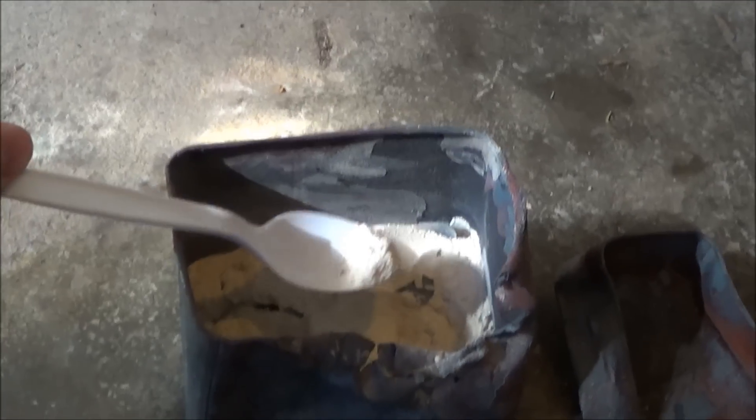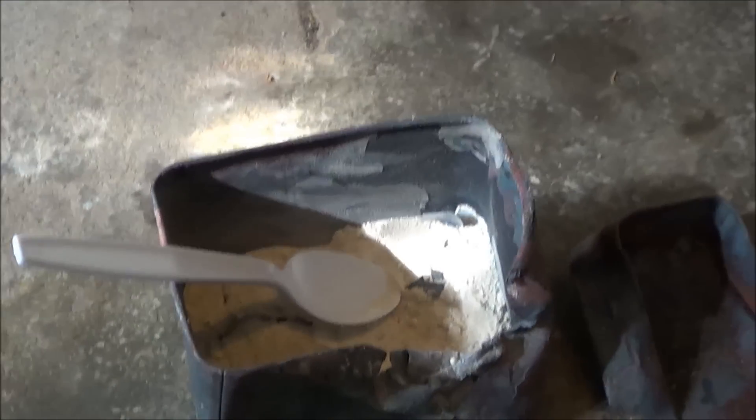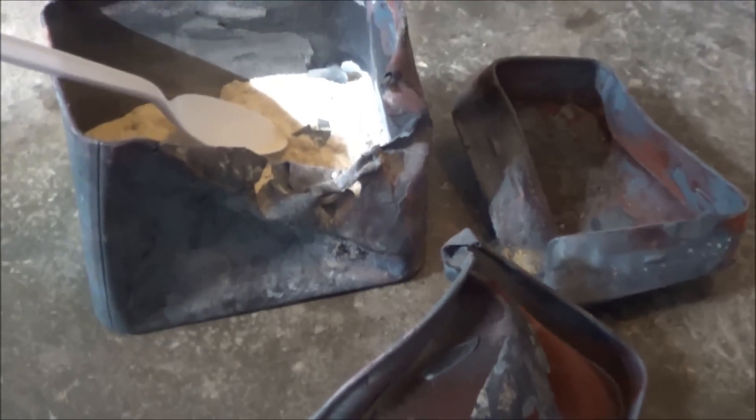This is the container after being rather destroyed in the fire. You can see that the colour of this solid has changed quite a bit — it's a lot lighter now than it was. I think it was quite a lot more brown. To me it looks quite different. Whether that's because of the oxidation or the thing we want, I don't quite know yet.